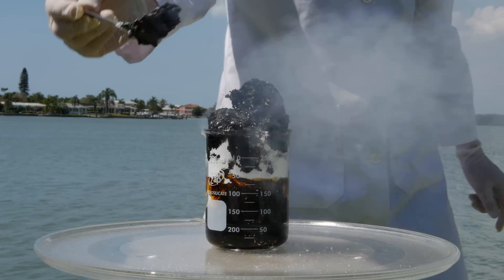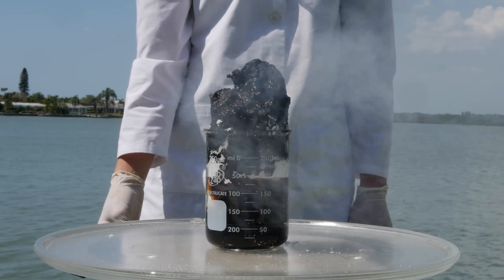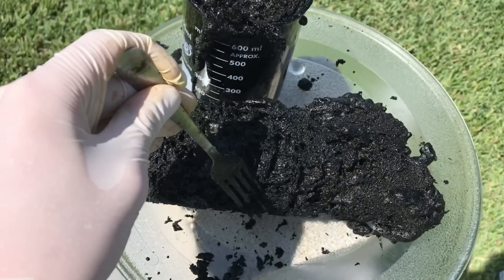And this leaves behind carbon, which is that black stuff that's formed. The steam that is produced in this reaction is what causes the carbon to bubble up and form those snake-like shapes. That heat and that steam is formed as the bonds between the sugar molecules are broken, and as that acid dissociates or breaks up. But this stuff is actually quite brittle, almost like cheese balls.